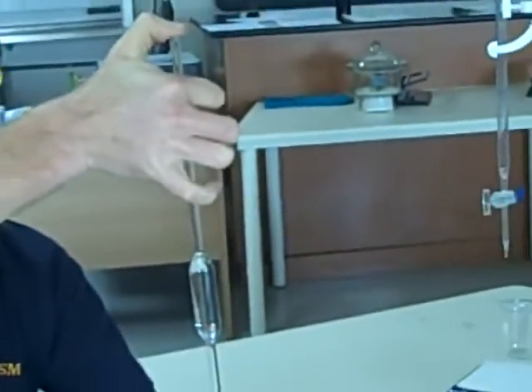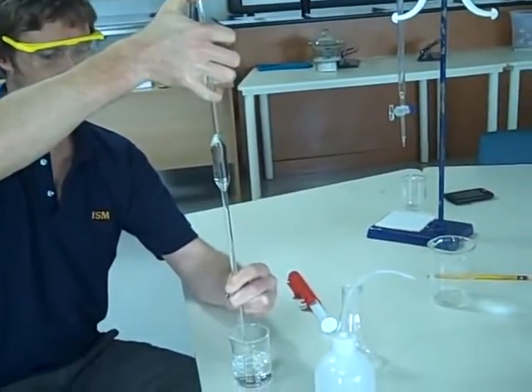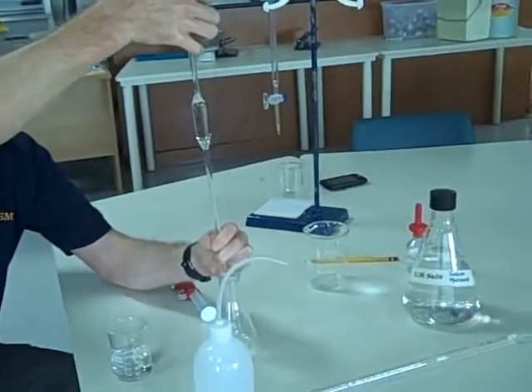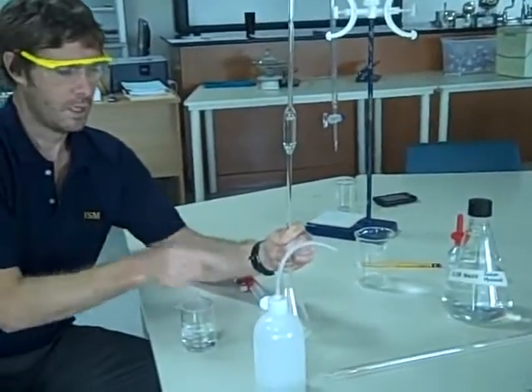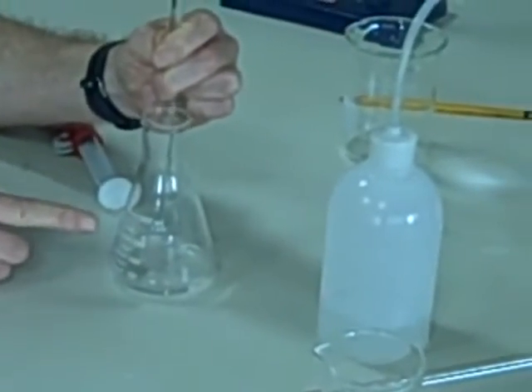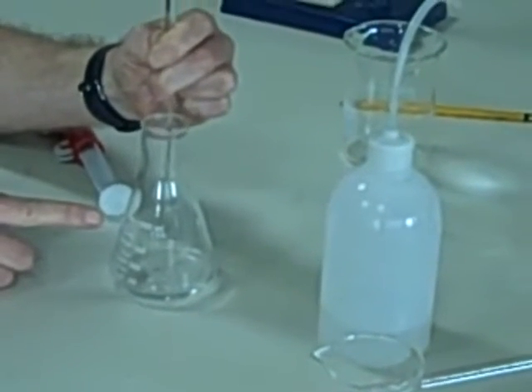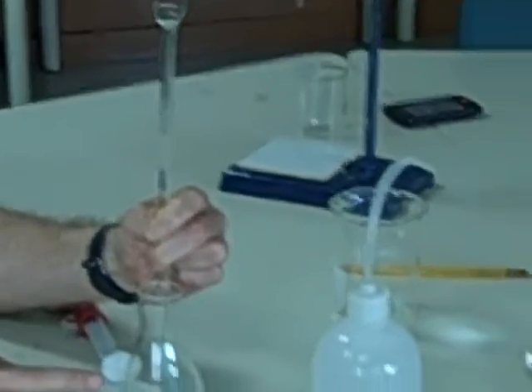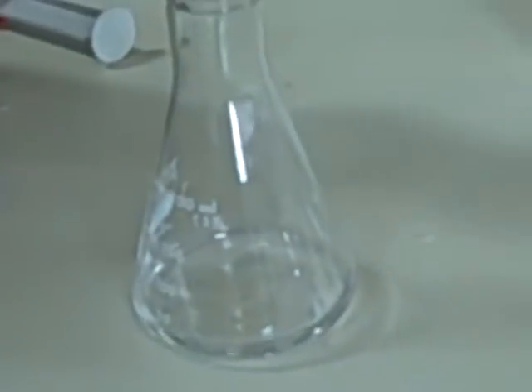And I did that correctly. I'm then going to transfer my 25 cc's of sodium hydroxide into my conical flask. I'll just let that come out. The conical flask must be clean. It does not have to be dry. As long as it's been cleaned several times with tap water and then rinsed through with distilled water, we're fine. Now watch this next bit.